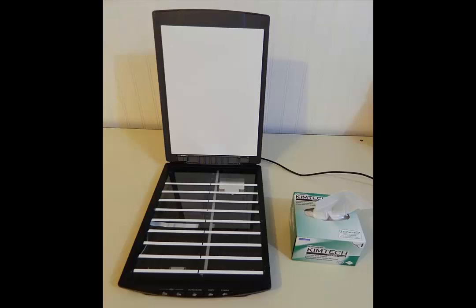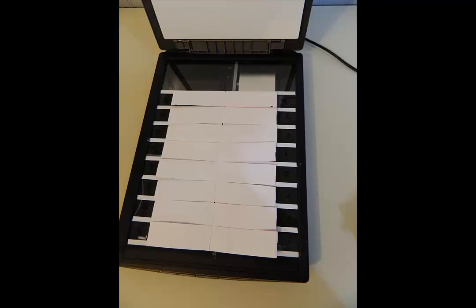To prepare your scanner, go ahead and divide it off into scan zones that are roughly the size of your cards. You can see here we've done this with white graphics tape. You don't want to use colors because they can affect the picture.